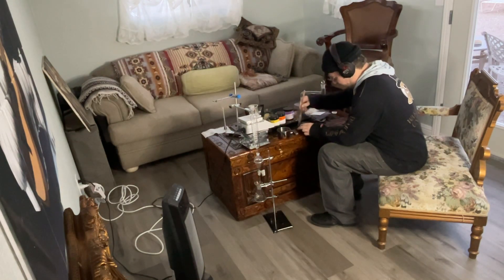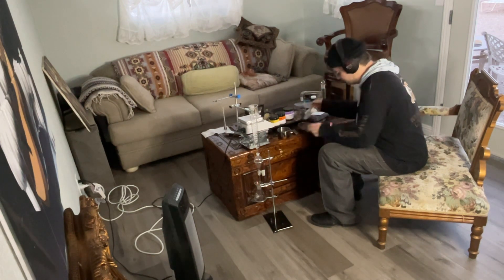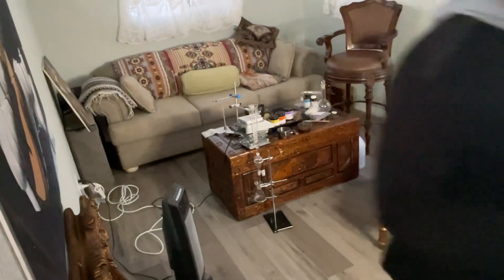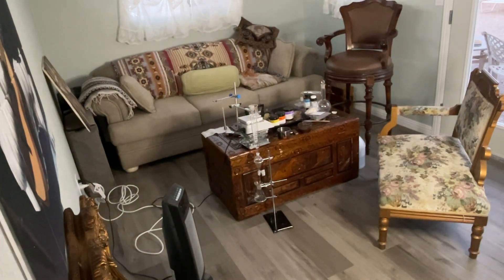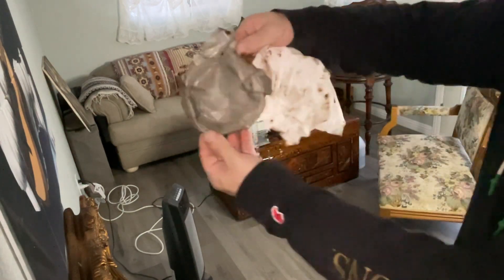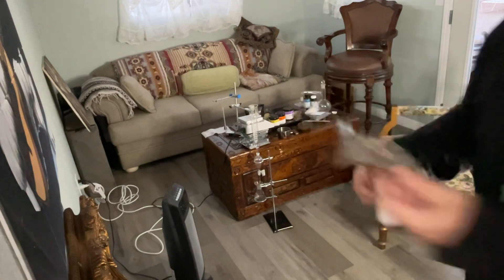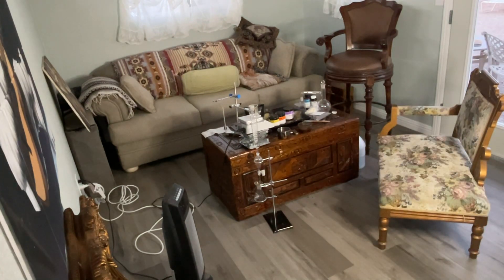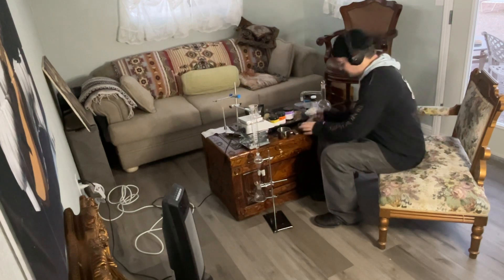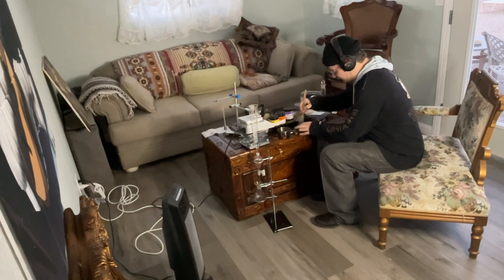I got the majority of it off the filter. There's a little bit left over in here — let me show you. There's the filter. Next is to — now these mushroom solids that are in here, we're going to break them down with the cooking off of the ethanol.